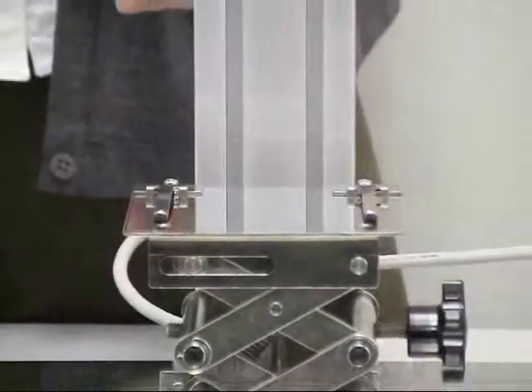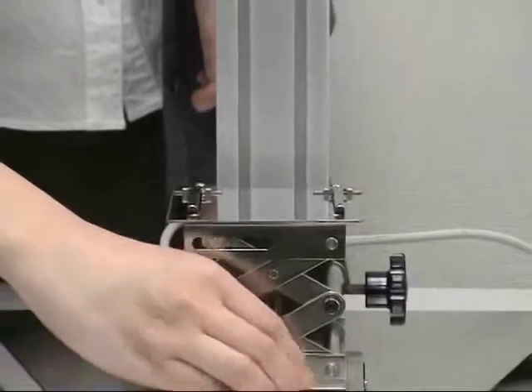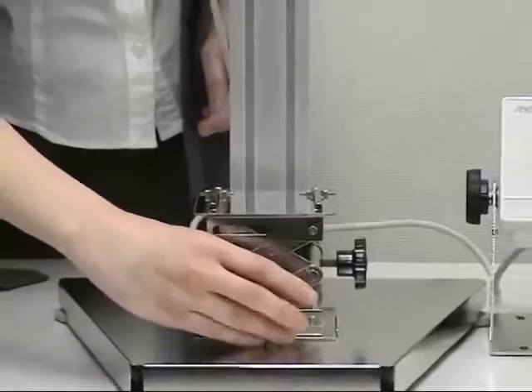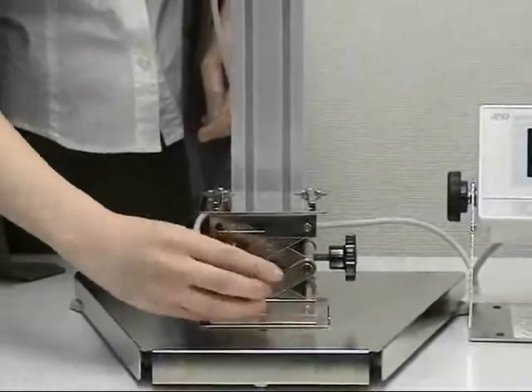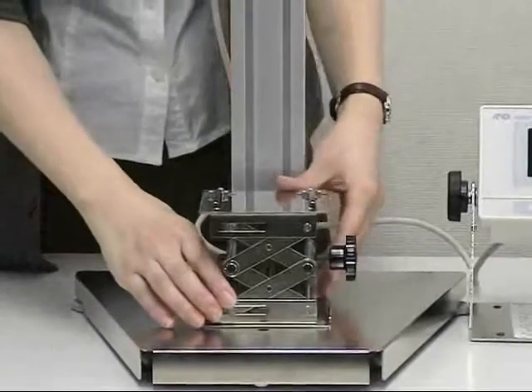The table is detachable. Take out the screw and slide the table towards you.